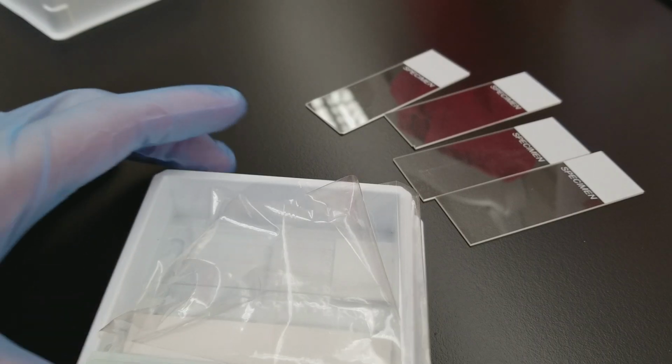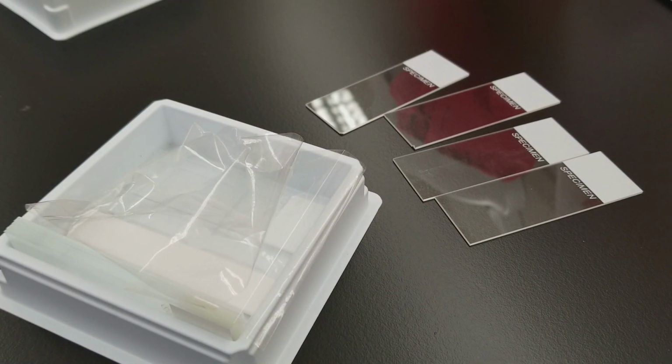Everyone. Today we're going to be talking about making hematology slides. Really excited about this video, so I hope you have as much fun as I'm going to have.